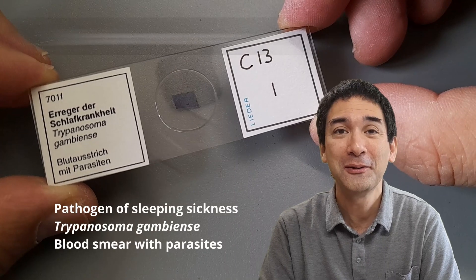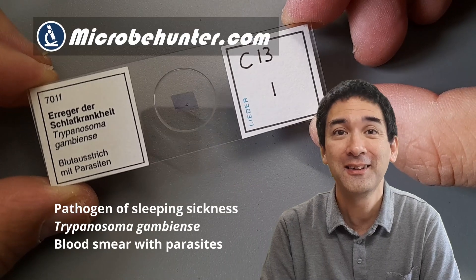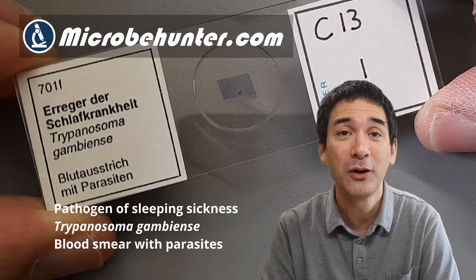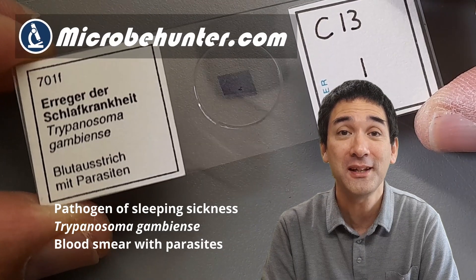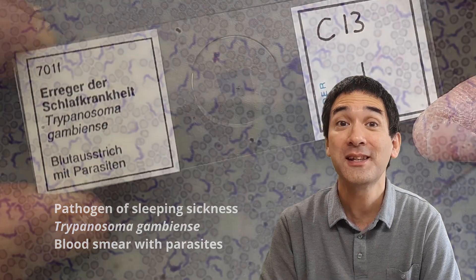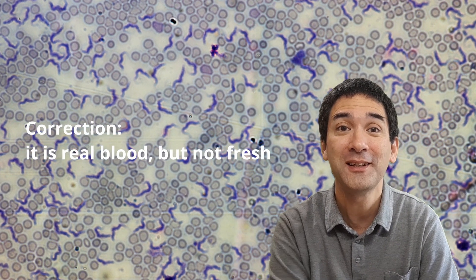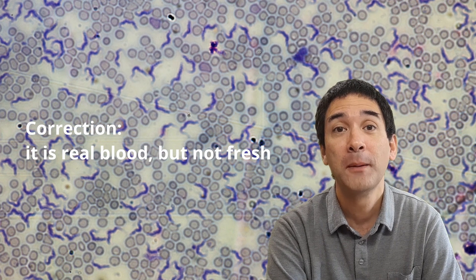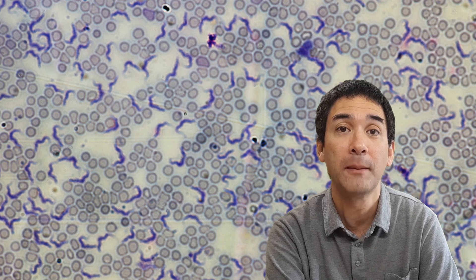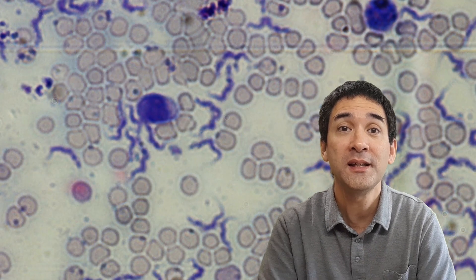Hello and welcome — Microbe Hunter here. This is the slide I used to take a picture of those parasites. It's a commercially prepared slide, so luckily it is safe. I do not want to put real human blood which is infected under the microscope, of course.